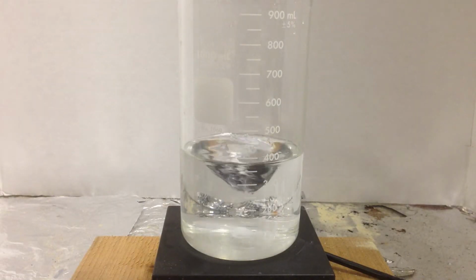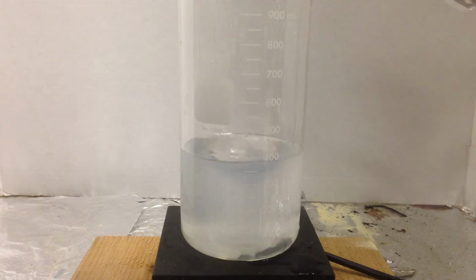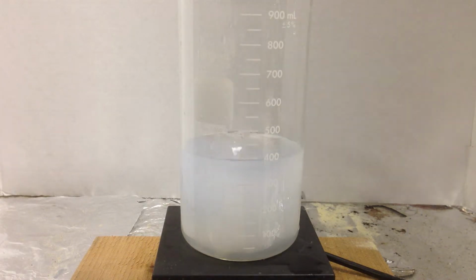We'll stop there and let's do it. Okay, so let's drop some base. And watch as we pull the H's away from the water molecules surrounding it. I'm using a pretty strong solution here. And you can see that I've got some clouding going on, so my strong base yanked enough of those H's, and I've created a precipitate.